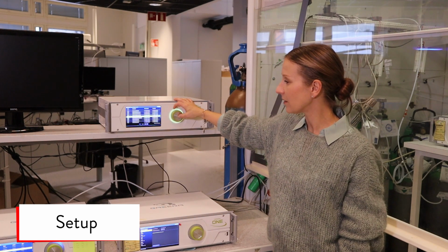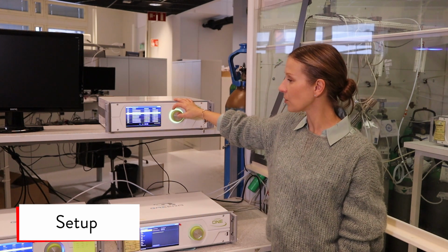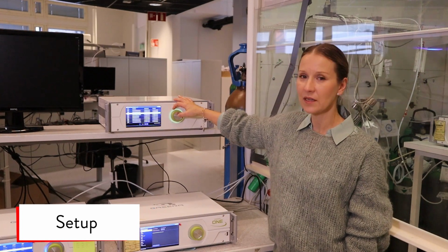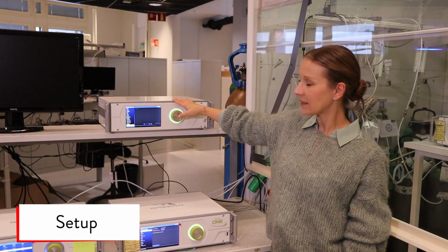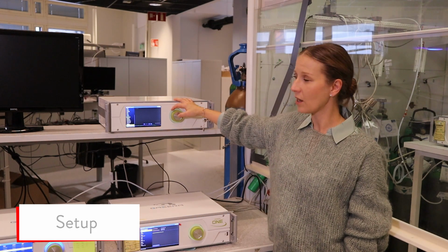There's mostly cell temperature low or source intensity low or source intensity high, source warming up, cell temperature low. These are all normal errors during the warm-up. And then there's the alarm log, which logs all the triggered alarms.